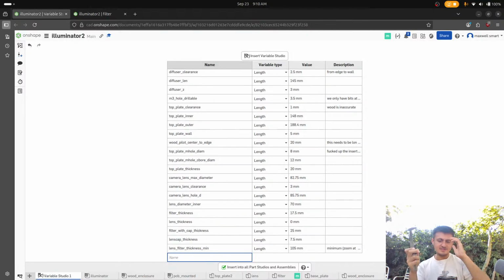Bro, every single part on this thing is freaking curved. It is so insane. Let's just do it like this by eye. Or could we do it like... No, we don't have enough depth for that.